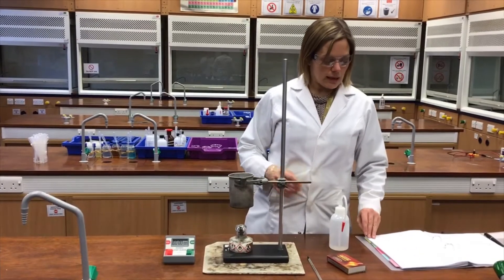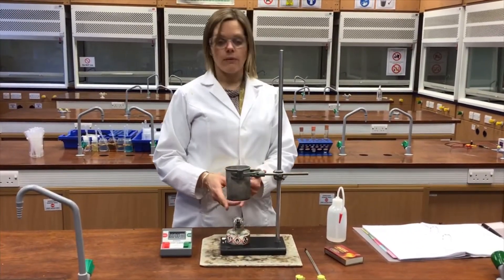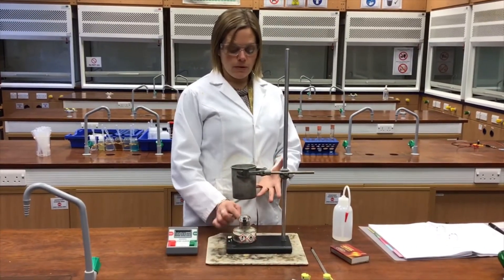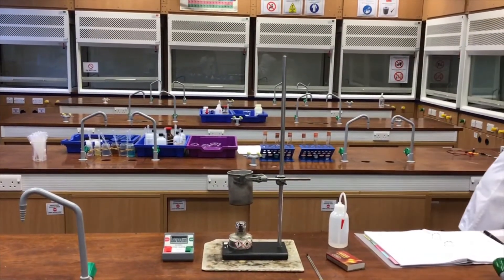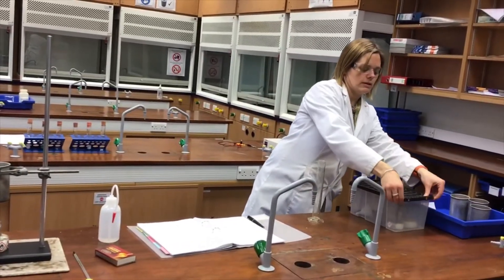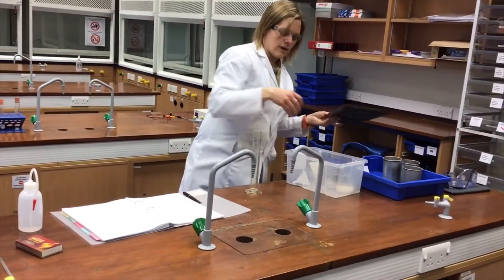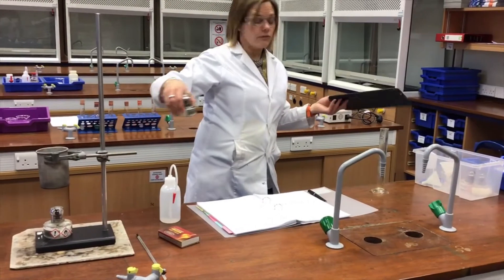Experiment A8 aims to determine the enthalpy of combustion of a fuel experimentally. The fuels being used are different alcohols, and the different spirit burners have different alcohols in them. This one, for instance, is an ethanol burner, and in this box are the ones with different alcohols — for instance, a methanol burner.